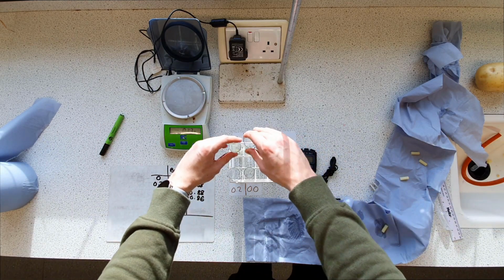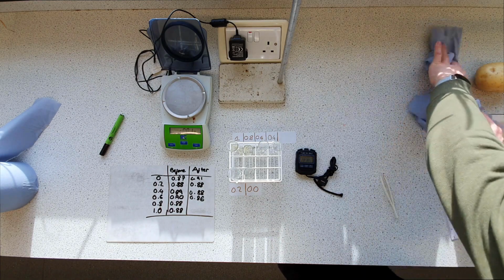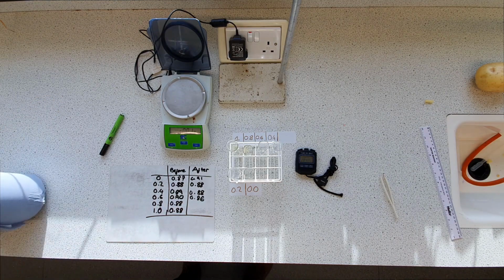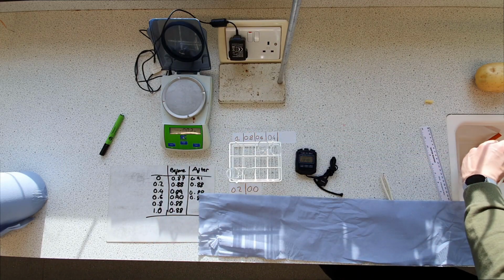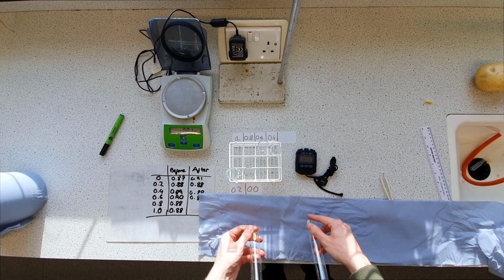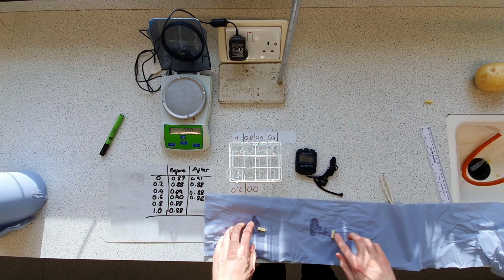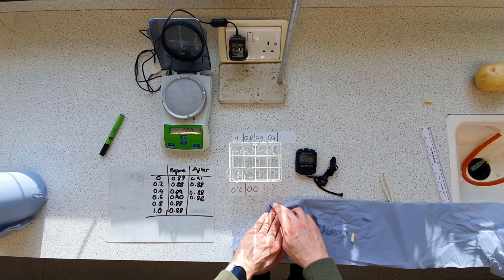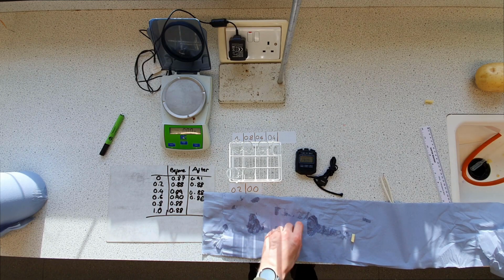We've got our final 2 cores. Just going to get some fresh tissue. It's all a bit sodden. Get rid of all that. Fresh blue roll. Right, our 2 cores. And so on the right we've got 0.8. On the left we've got 1.0. So we'll just blot those dry as well. Oops. Shouldn't mix those 2 up. Okay, so I'm calling that more or less dry.